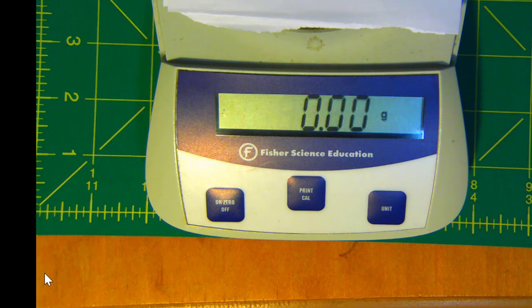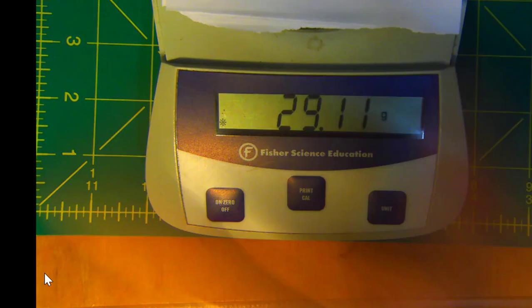So let's go ahead and take the beaker and put this on. I will say that we don't normally have this piece of paper on when we would do this in the lab. It could lead to some errors if we're not careful. But for today, what we're doing, it should be fine, and it will make it easier for you to see what we're measuring. So put the beaker on the balance, and you see the mass there on the display. That will be what you would write for the mass of the beaker.